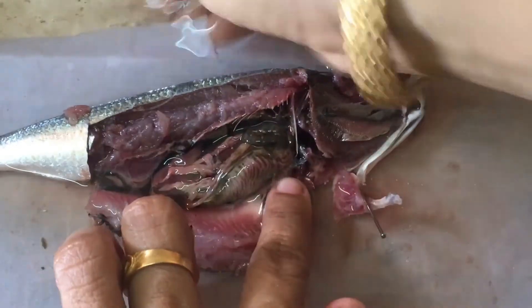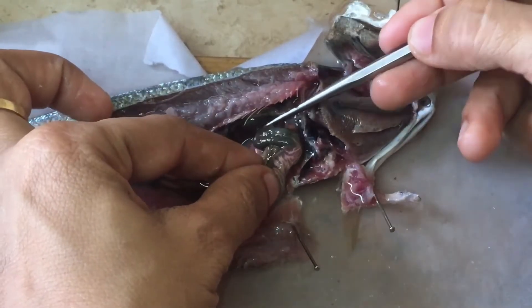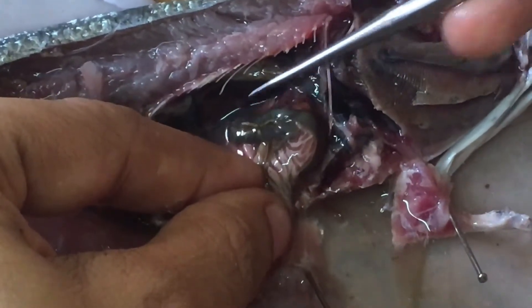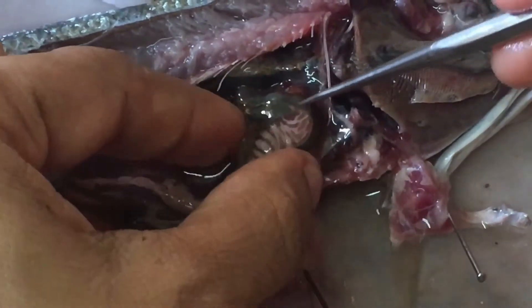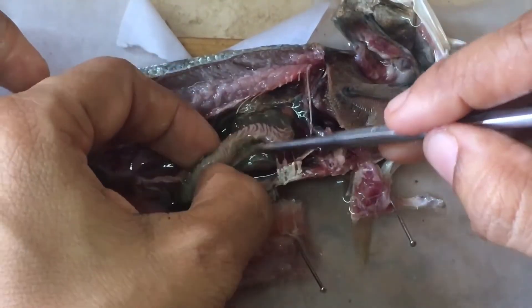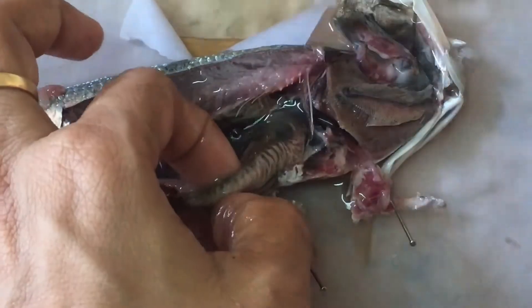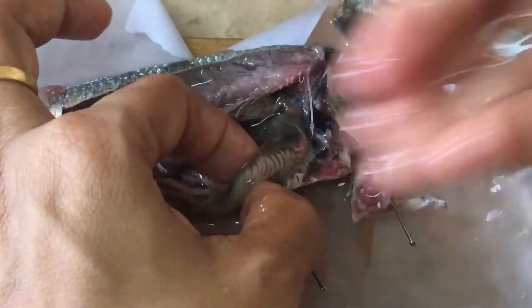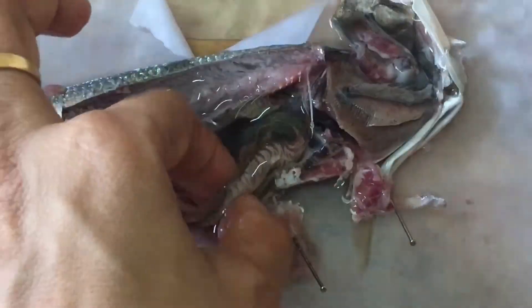Do you know which is the most important tool you need for this practical? That's a secret tool — it is your patience. Whoever is short-tempered should not attempt this practical, because it is very tedious to uncoil the intestine without breaking it. So use your patience and flush water according to your requirement.